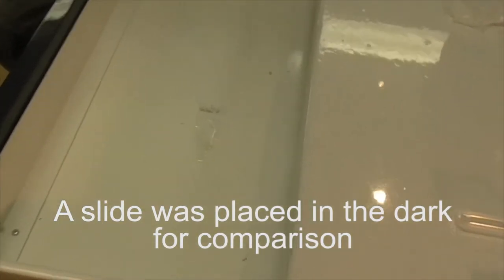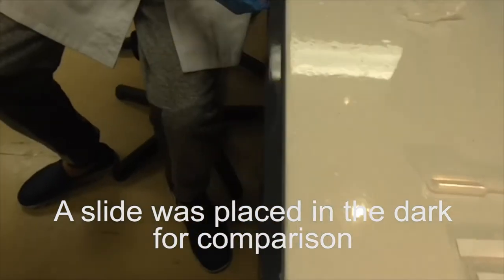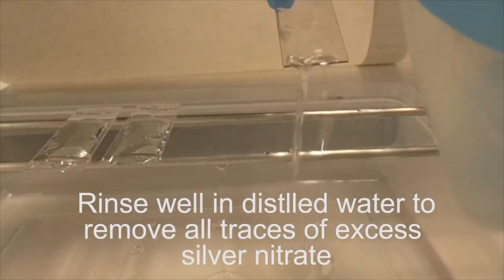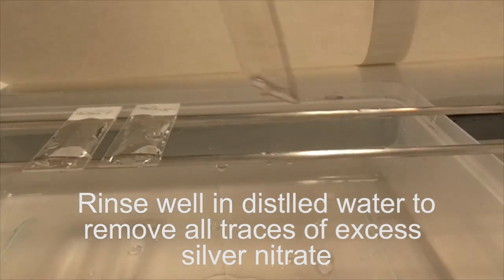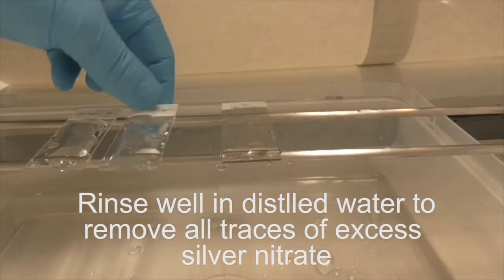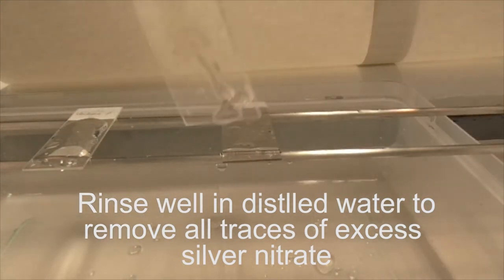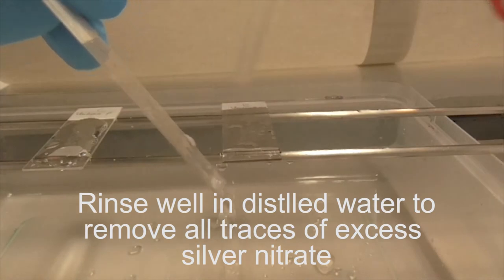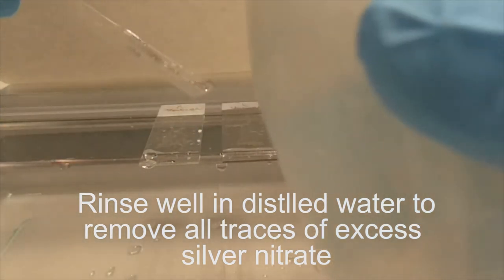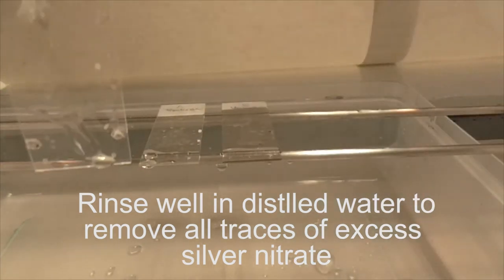Another section was placed in the dark for comparison. When completed, rinse the section in distilled water to remove any excess silver nitrate solution that may be present. Make sure to wash the back side of the slides as well.